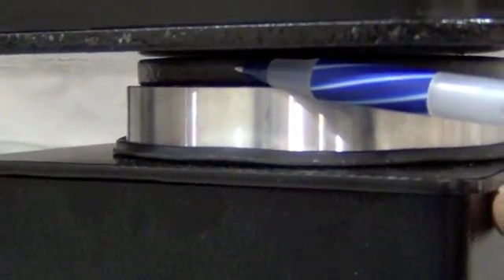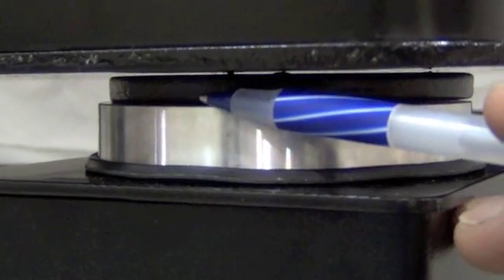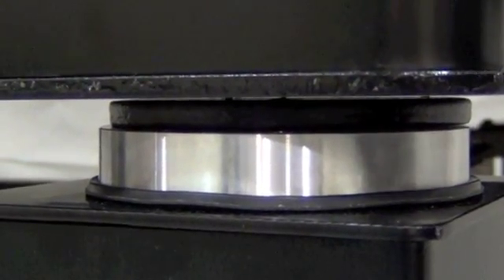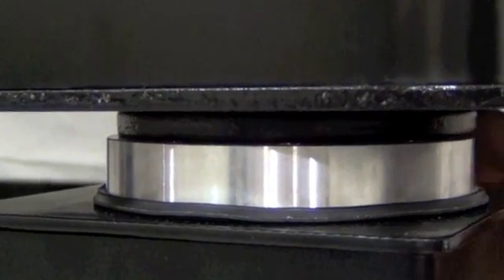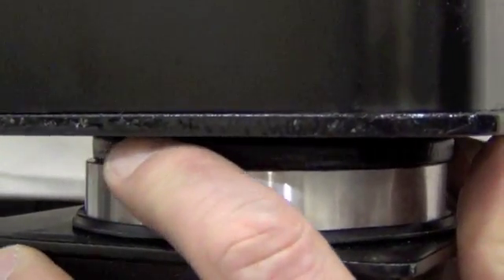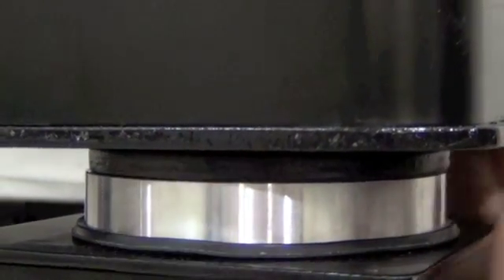Make sure the black load discs are centered on the aluminum clamp ring. For smaller tables, you can push sideways on the load disc to center it. For the larger tables, you may need to utilize the leveling foot to take some load off that particular leg in order to center the load disc.